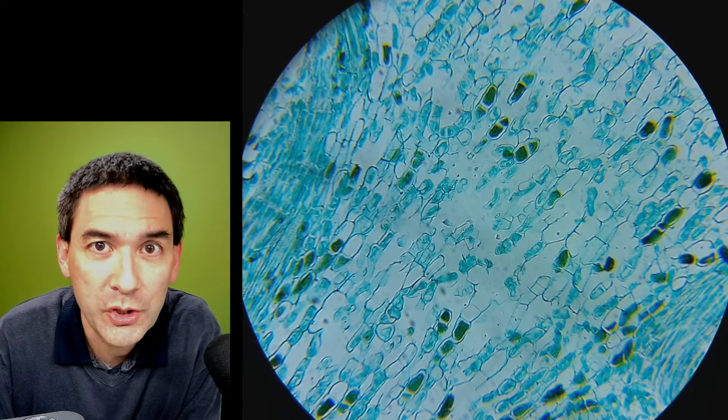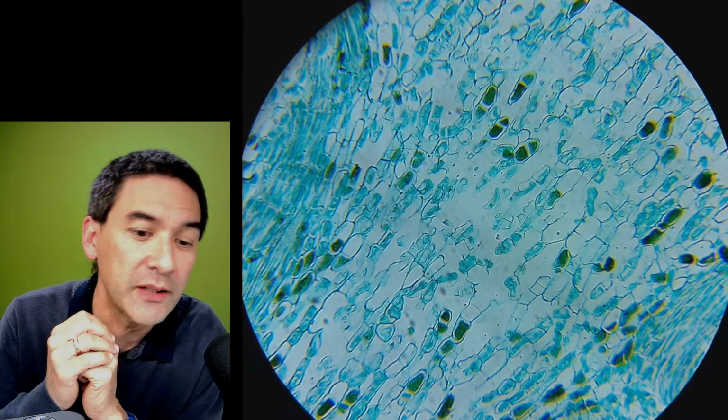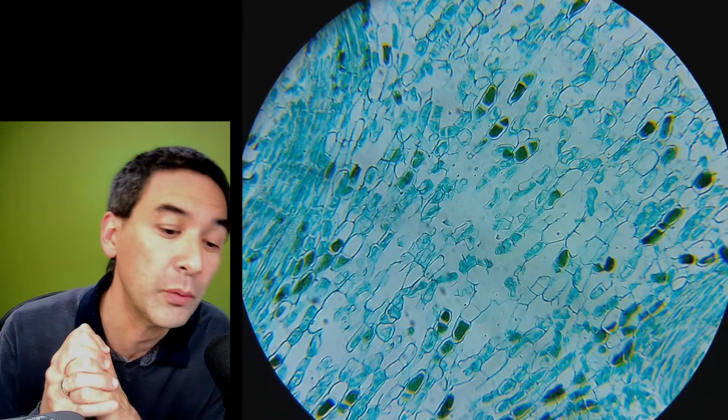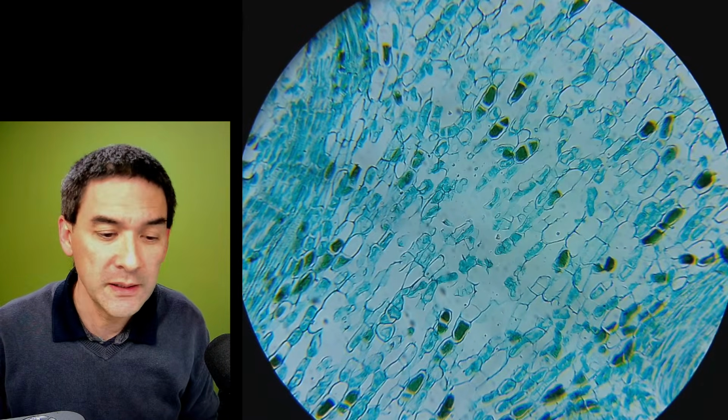Yeah, demonstration effect. It's flickering a little bit. I don't know if you can see every now and then those lines. I don't know why it started doing that. That is simply a slight problem with the mobile phone or the connection. We just have to ignore that.